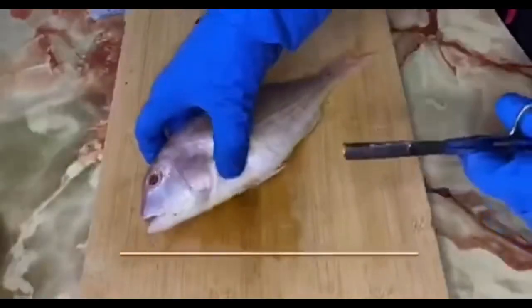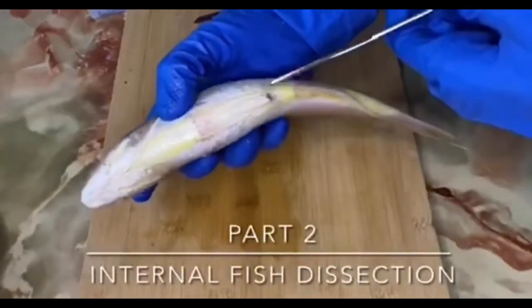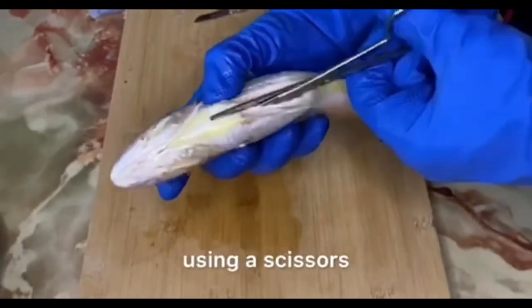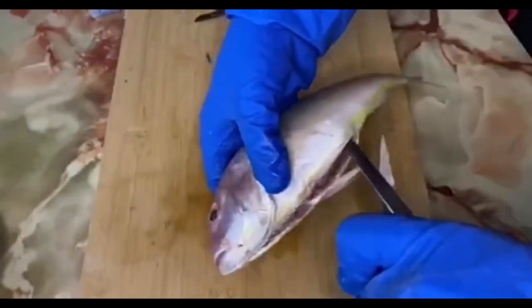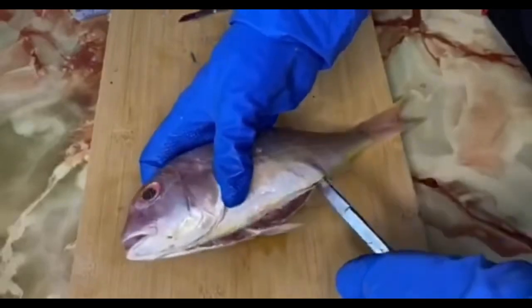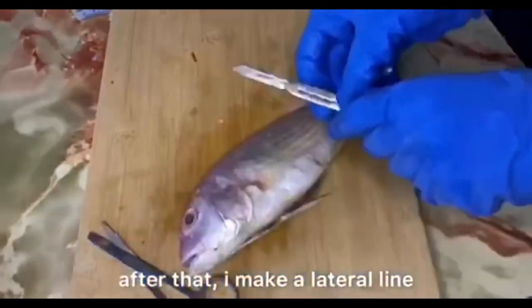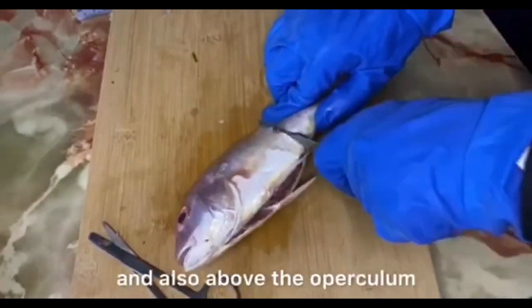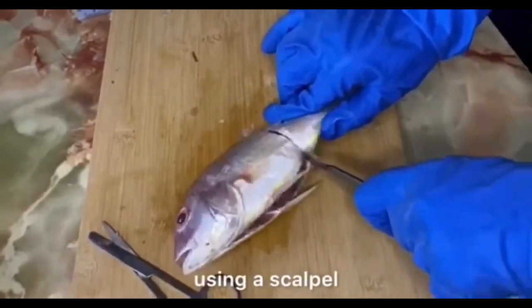Part 2: Internal fish dissection. I start with cutting from the anus all the way up to the upper operculum using scissors. After that, I make a lateral cut above the anus and also above the upper operculum using a scalpel.